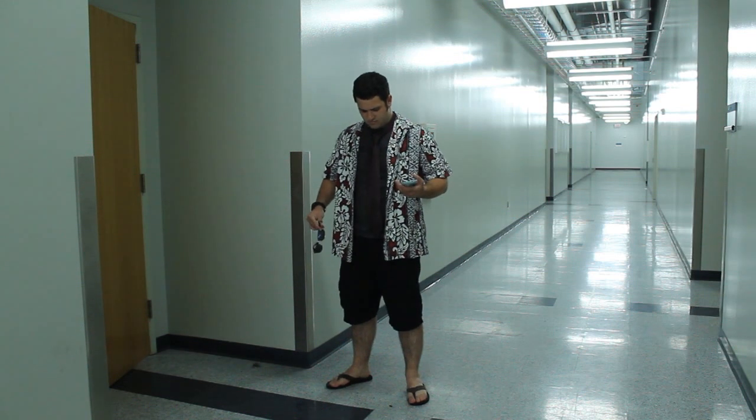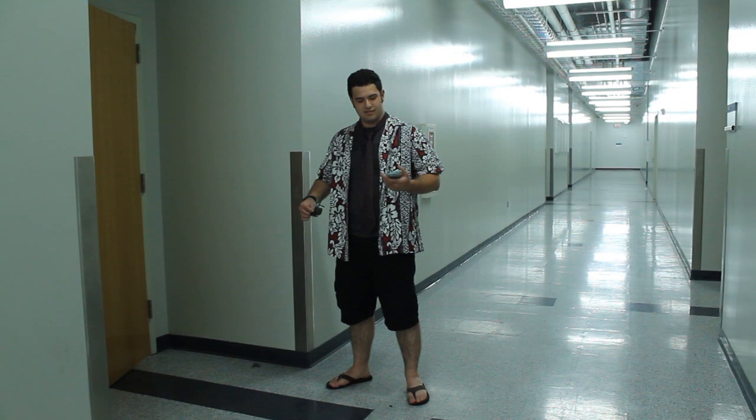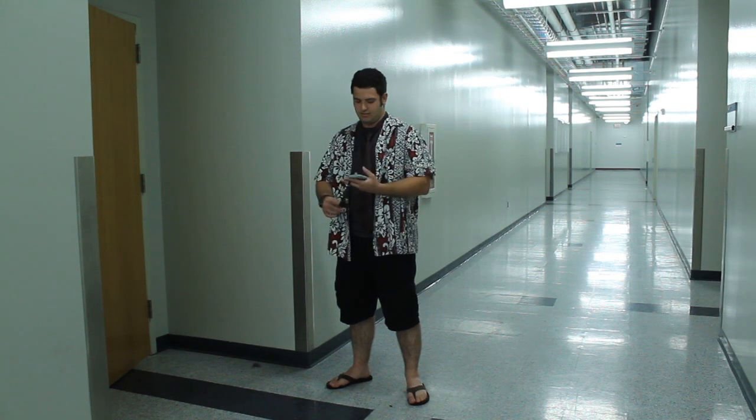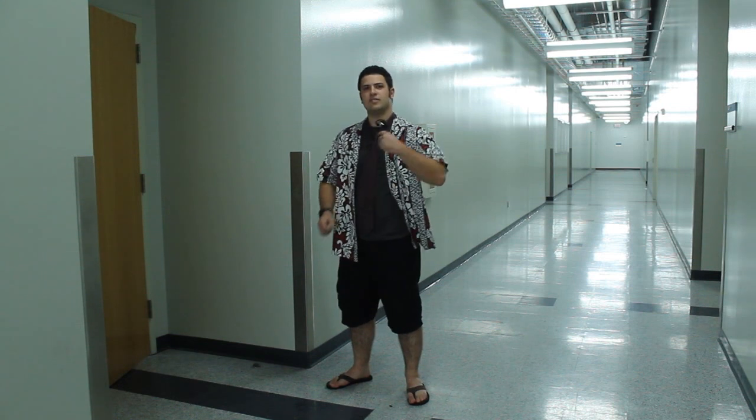Your hair is short, so you don't need to tie it back like you would if it was long. However, your cell phone is too much of a distraction. Go ahead and turn it off. Thank you. Now you may enter the lab.